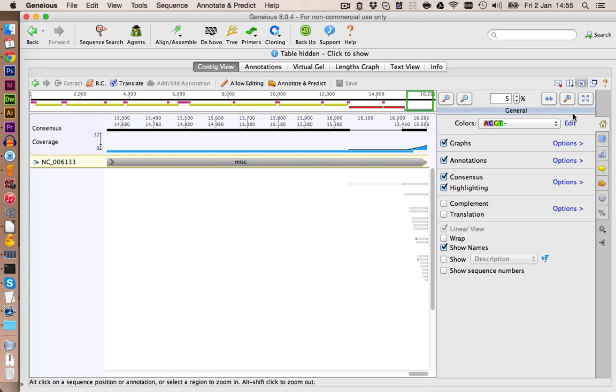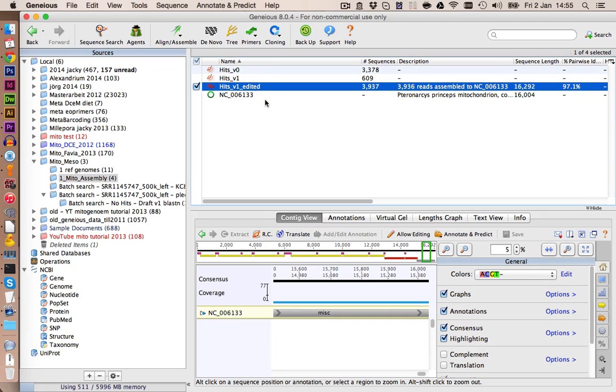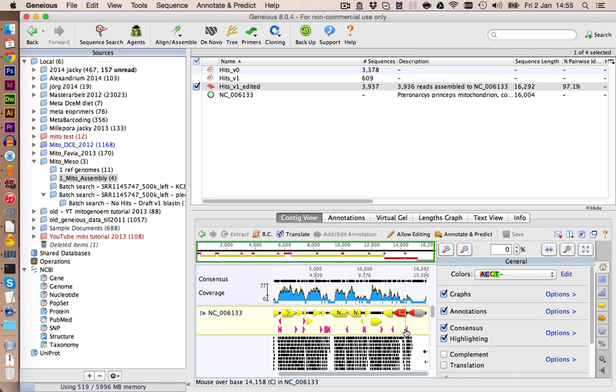Okay, now we save this document. And also let's rename this one maybe to hits version 1, edited, so we know it's associated with this last one. If we do further assemblies, we should add additional reads to this mapping right here, which we have now edited. If we would choose all the hits again, we would probably get the same errors with the microsatellites again.